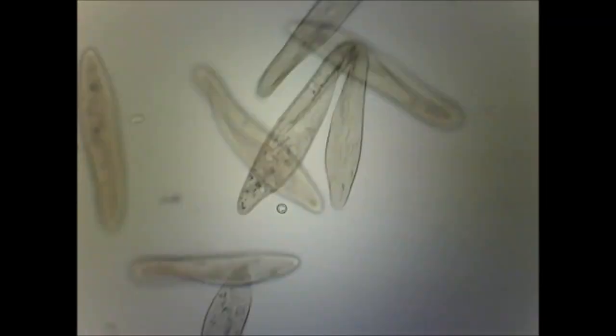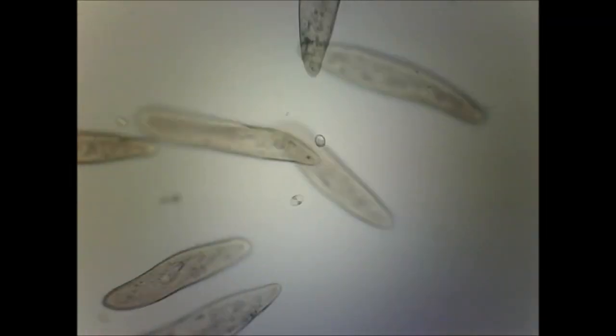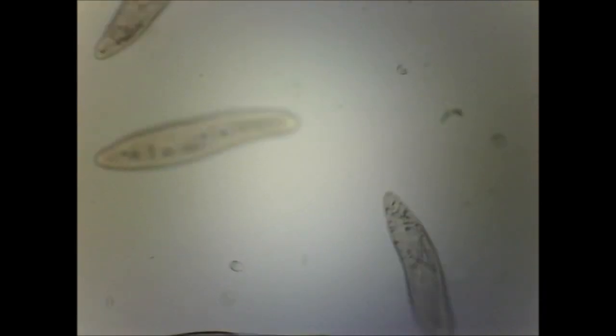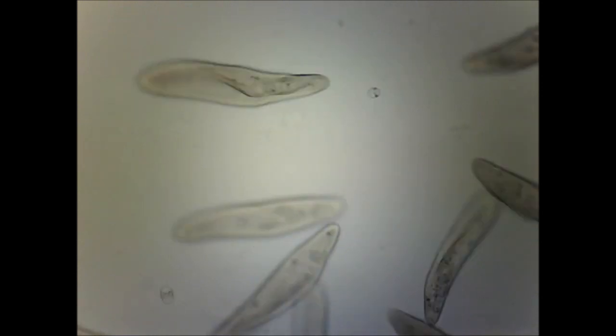If you get lucky, sometimes you get a view where there are not quite so many, but they're still moving fairly rapidly and you don't get much detail. We're going to pop some paramecium into something called methylcellulose, which is going to slow them down and allow us to get really up close and personal in this clip.